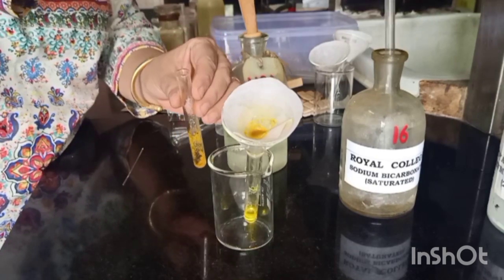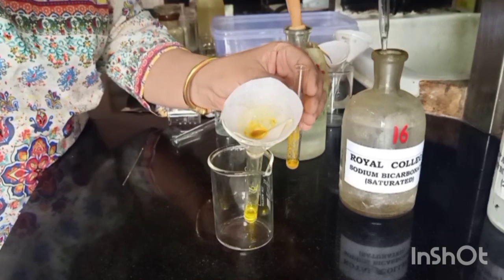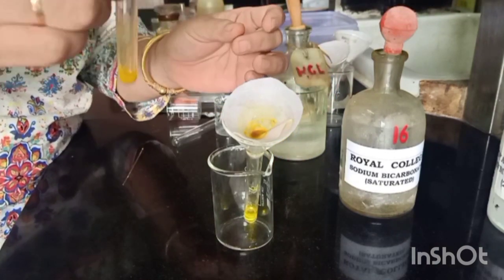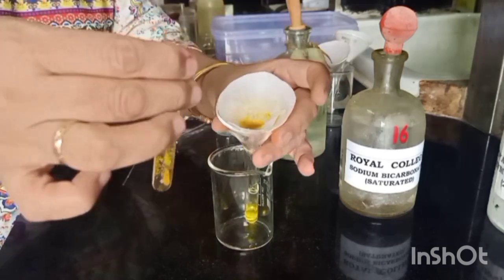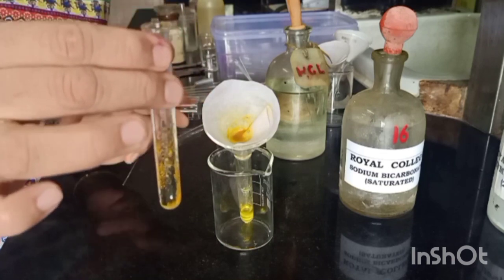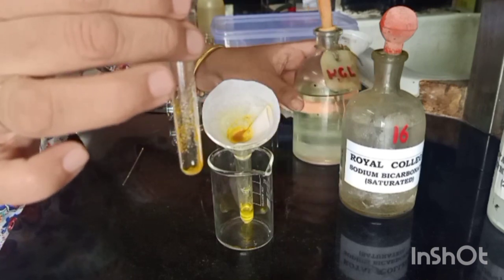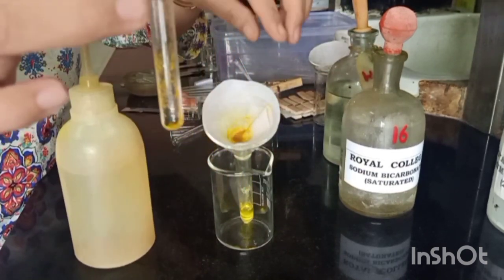As you can see, that's the residue which would be containing our component B. One more small washing with bicarbonate to remove any residual acid. And then we will wash with water. This is to be remembered that we always wash with water before every succeeding step to remove any reagent of the earlier step which may be present.